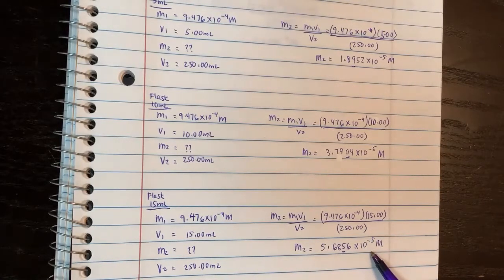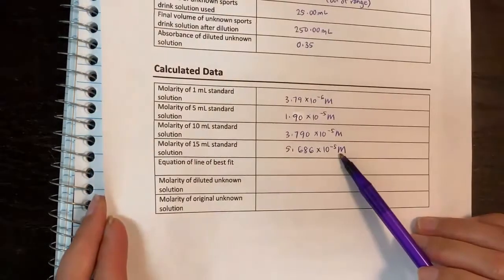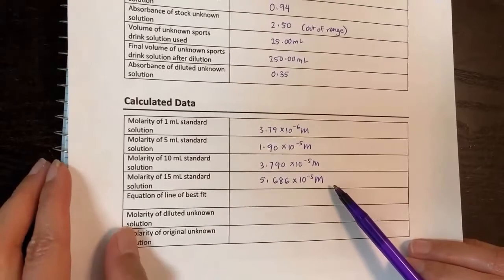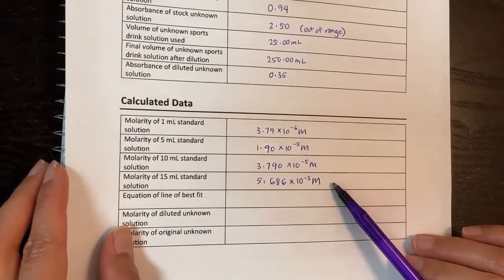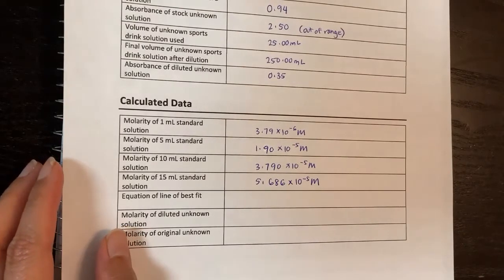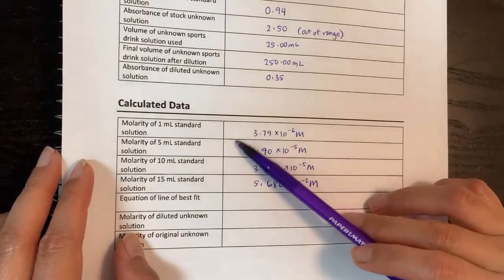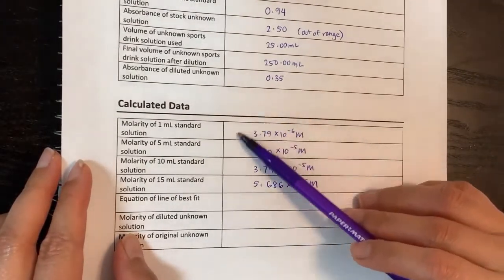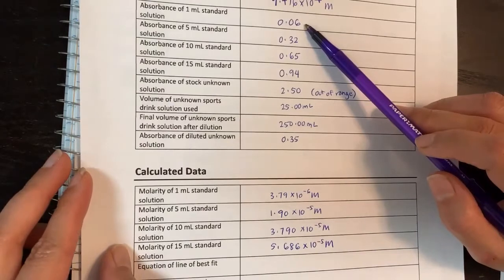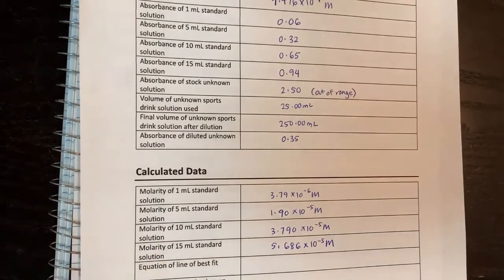For Flask 4 with 15 mL, M1 and V1 are known, V2 = 250 mL. Plug in and solve for M2 — keeping four significant figures — and write it in the table. Once you have all four molarities calculated, you need to open your Excel file and graph absorbance versus molarity. Molarity will be your x-axis and absorbance will be your y-axis. Watch the separate graphing video to see how to make this graph.